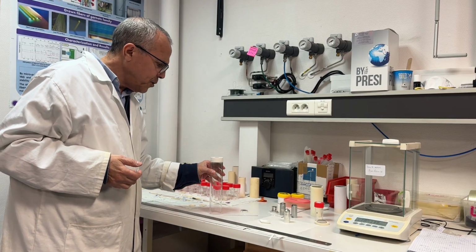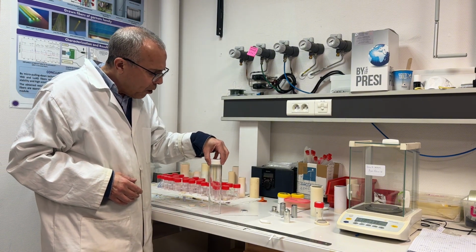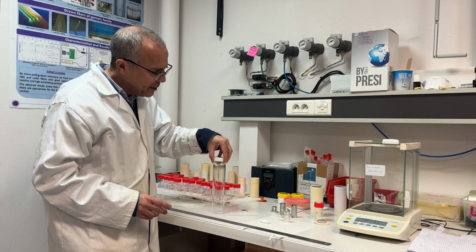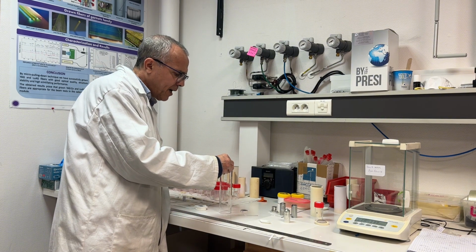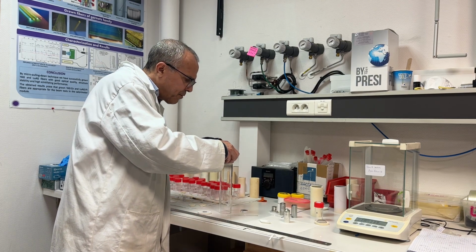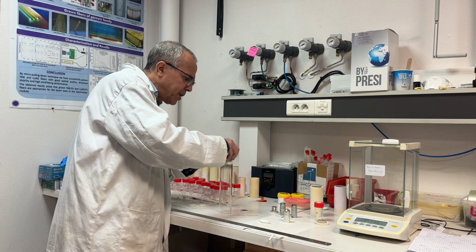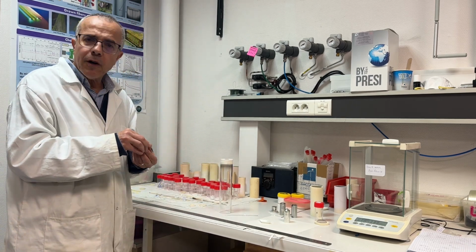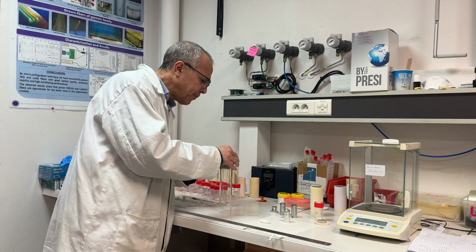That is the support that we put inside the machine. It is composed of a quartz tube, and we put three ceramics on the top. We have to do it carefully, slowly, because if we don't do it slowly, we can cause some damage. For example, we can break the ceramic, and we can get some trouble which will not be useful for the growth. Then after that, I will use a small ceramic support. It is alumina, I put it here.